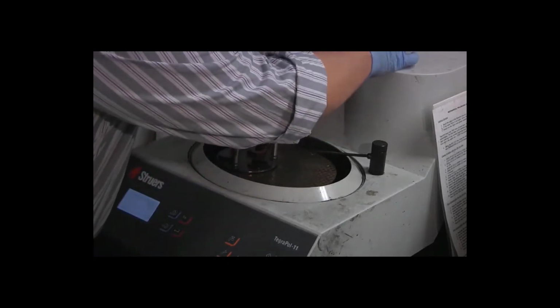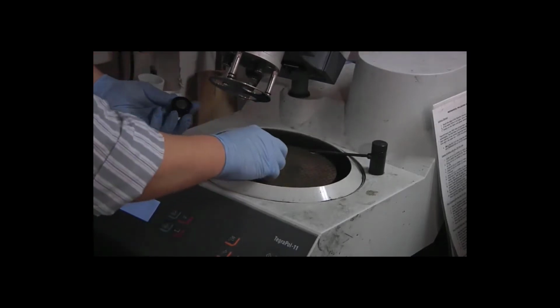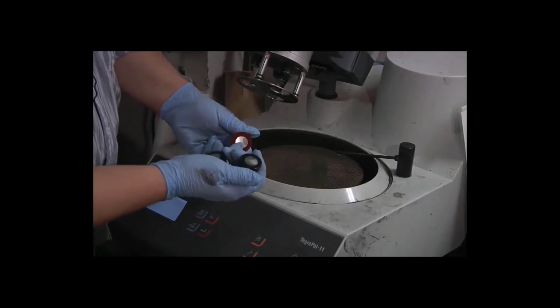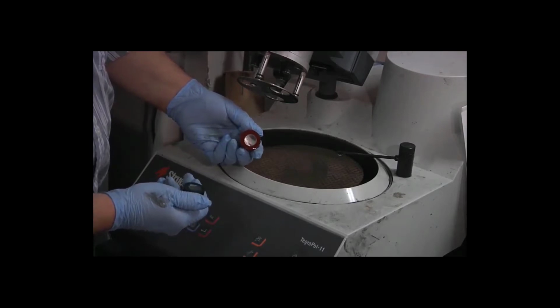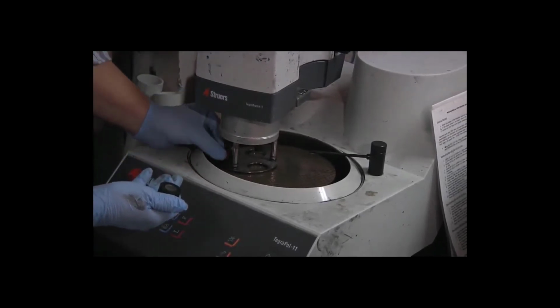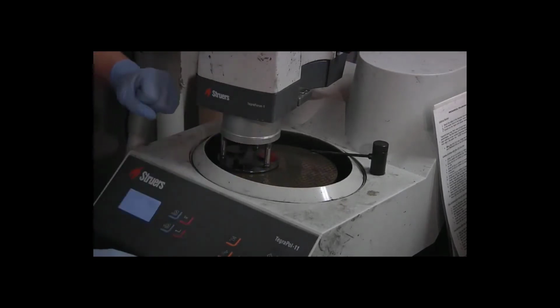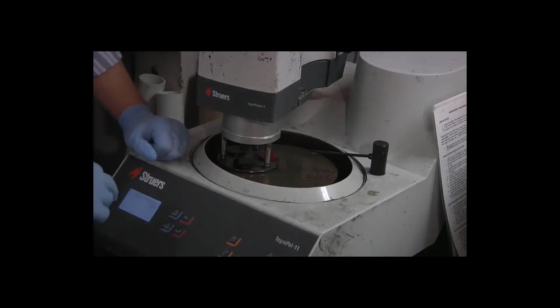So after the second cycle on the coarsest grinding, we're going to look at our specimens. I can clearly see that the green one isn't flat, nor is the red one. I can still see a significant depression there where the material has a completely different appearance. We want to repeat this first grinding step as many times as is necessary to get a good uniform surface, because that will give us the best results from the remainder of the steps. And this first grinding step is the only one that actually removes any significant amount of material.